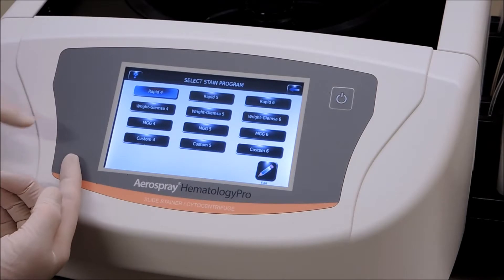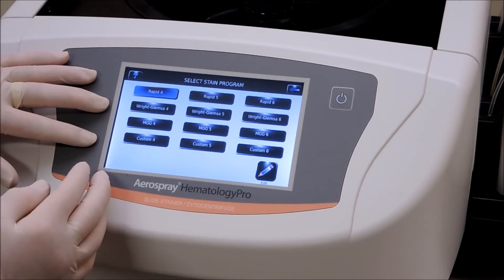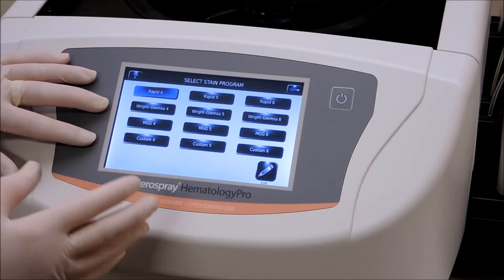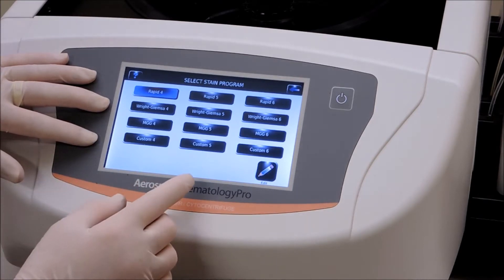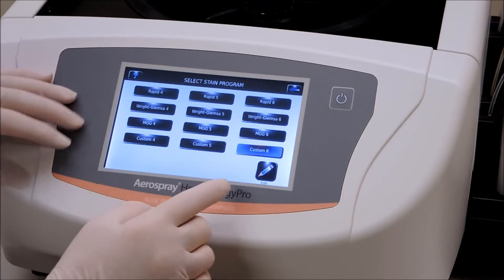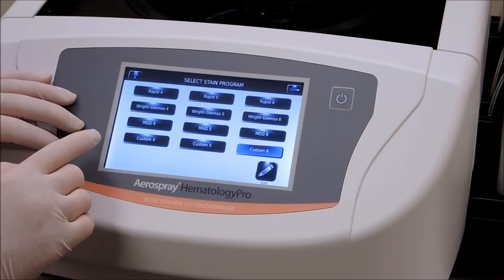As you can see, all the programs are filled — we don't have a place to make changes. So what we need to do is define an area, a program that we won't use. We're going to assume that we don't want to use custom number six.